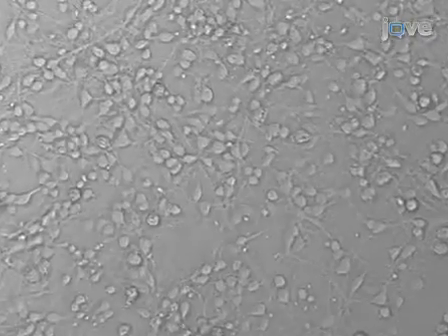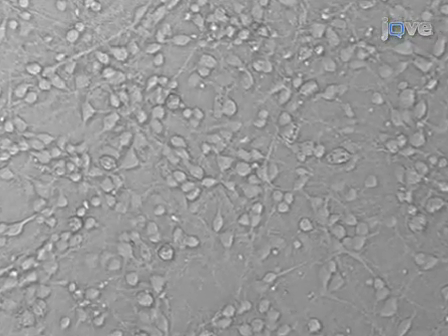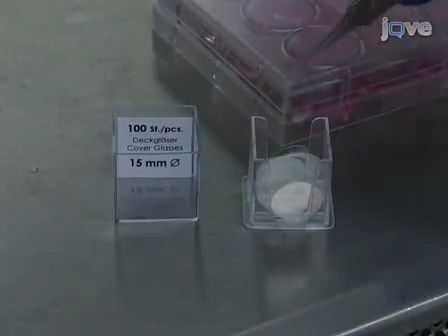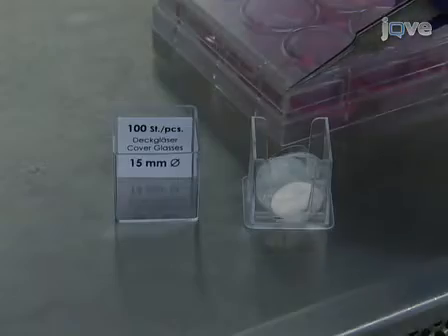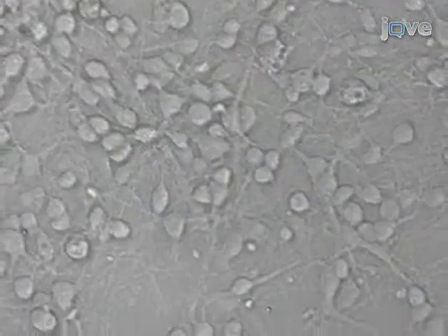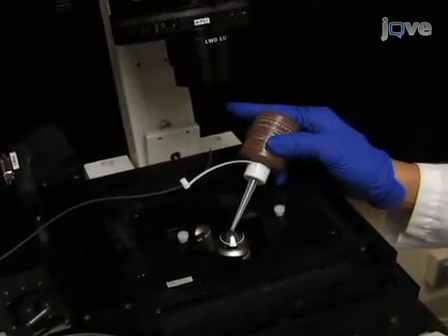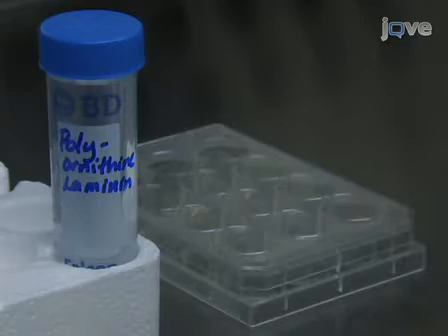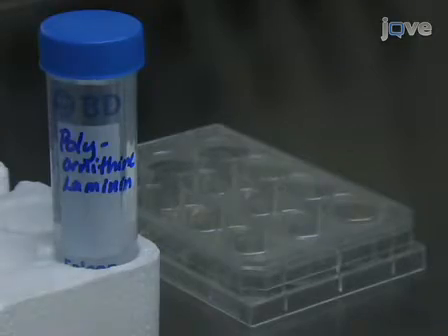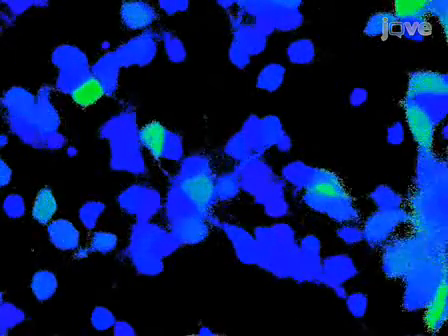The cortical neurons used for this calcium imaging procedure can be grown using established techniques, but should be plated on 15mm number 1 glass coverslips because low fluorescence imaging of live cells is best achieved with high numerical aperture objectives that require oil. We pre-coat the glass coverslips with polyornithine and laminin to prevent the cells from detaching or moving during imaging experiments.